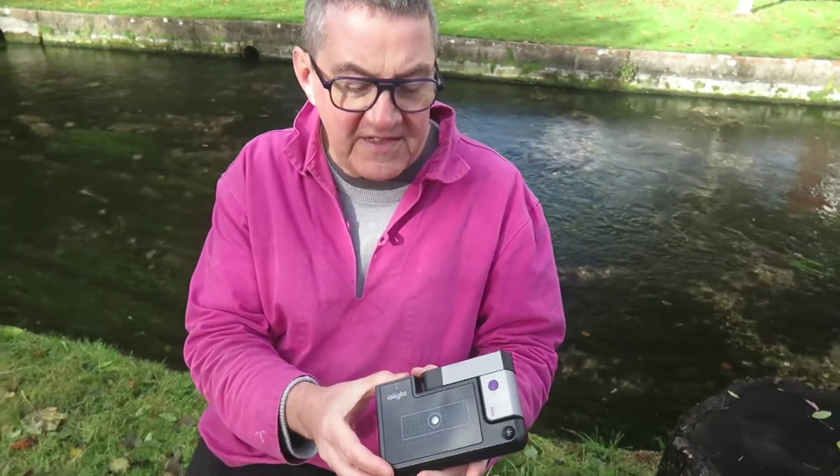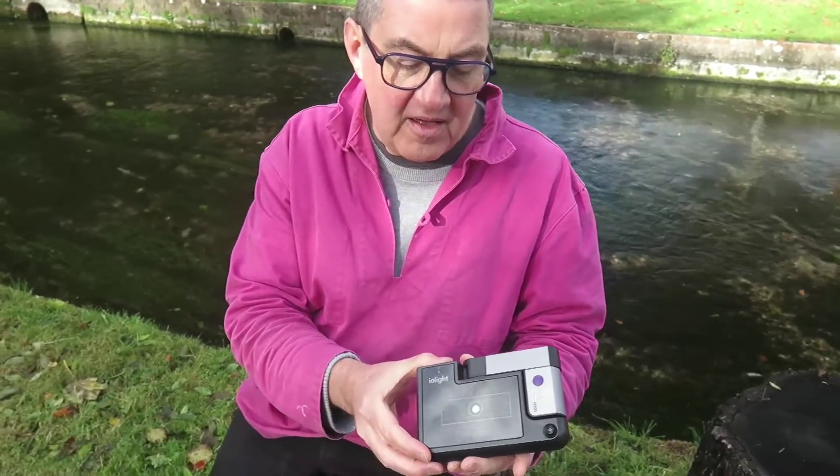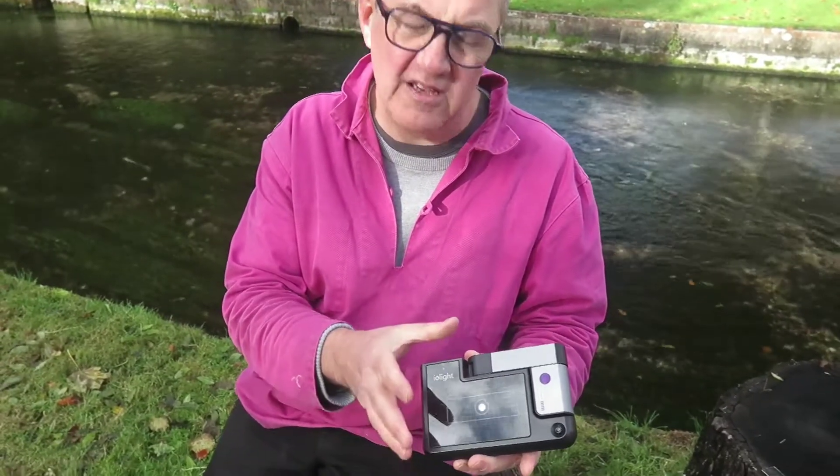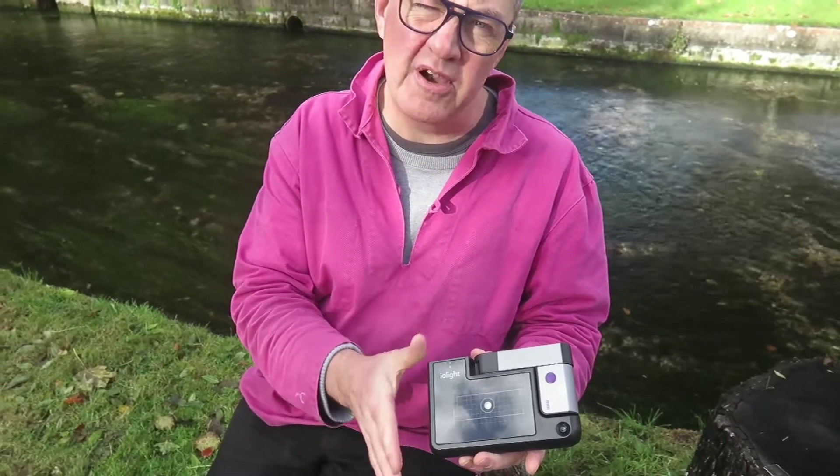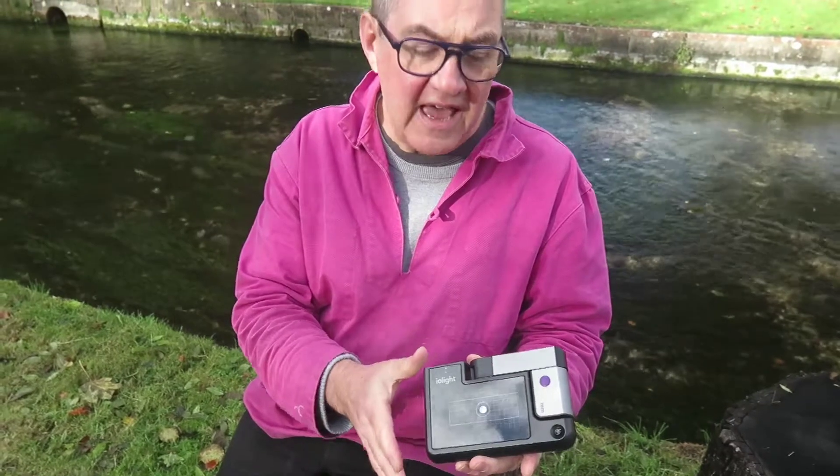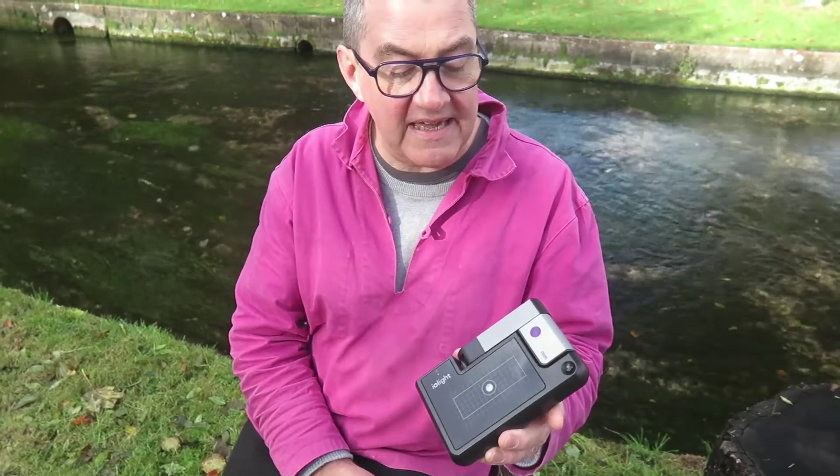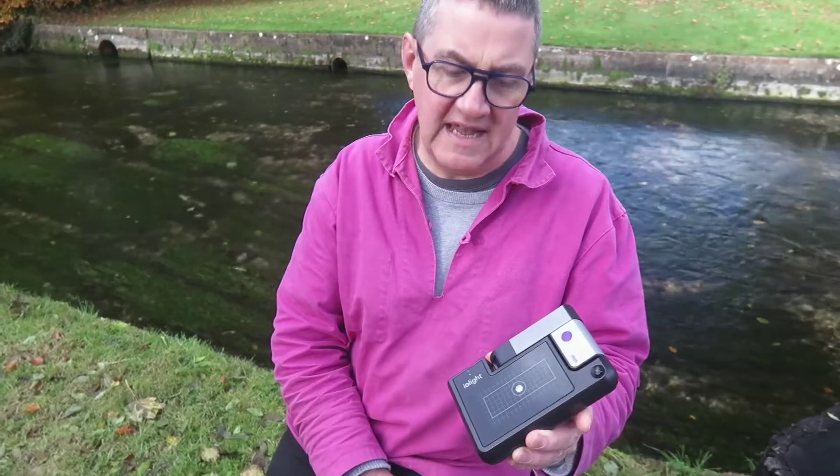We've left these off in order to make sure we can get the price right down and in order to make it simple and compact so it fits in your pocket. But that still leaves the question of how do I get an image on the Magnificent Mobile Microscope? Let's have a look.